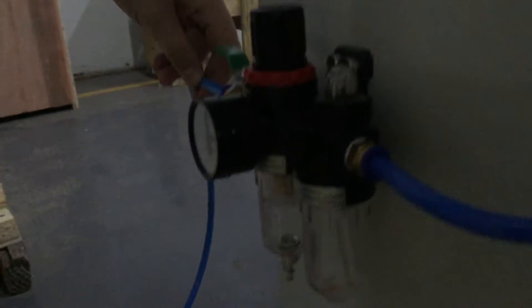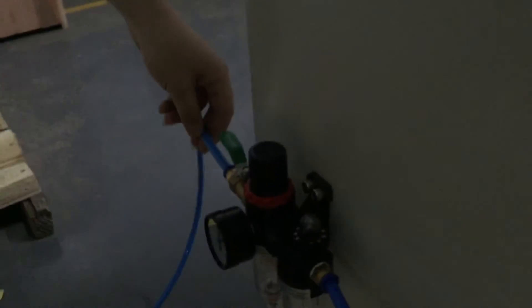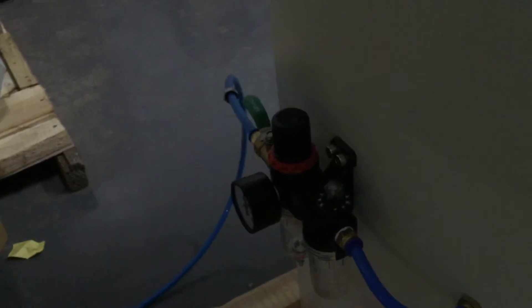On the left side, there is the air source connection port. Before using the machine, we need to connect the power source and the air source to the machine.